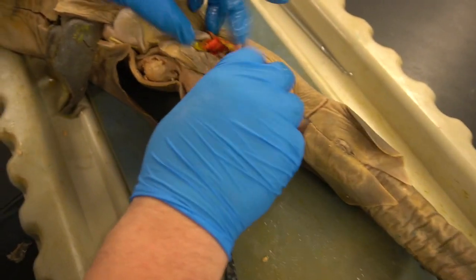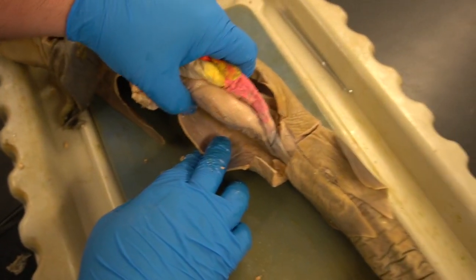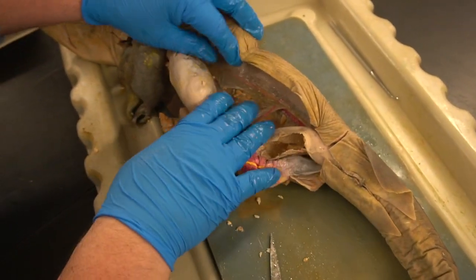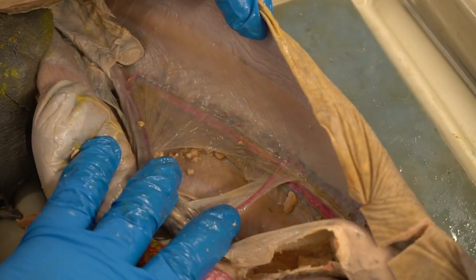Okay, so as I pull this around, I can separate this theoretically. If I clean the whole way up, I can separate all this from the body wall. Although I don't want to do that fully yet, because you can see some nice evidence of the blood vessels and stuff running up and down this, which I do want to get you a chance to look at.